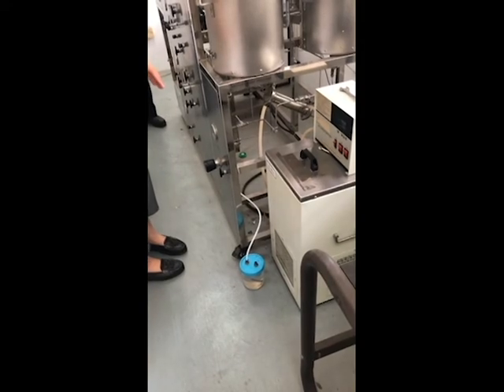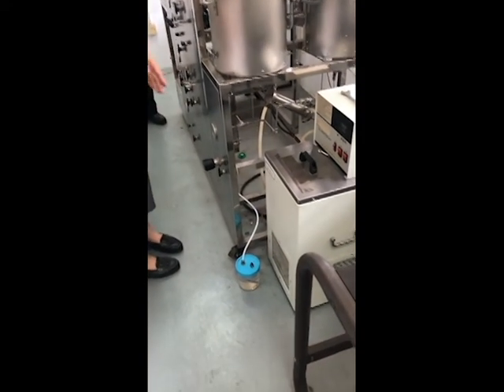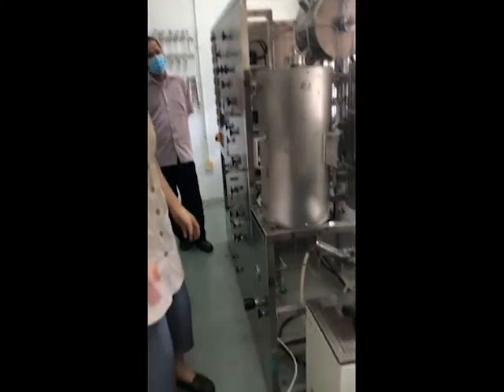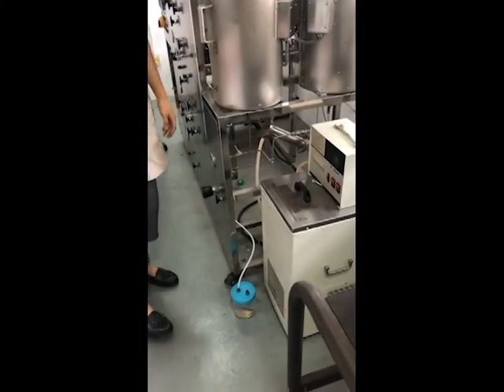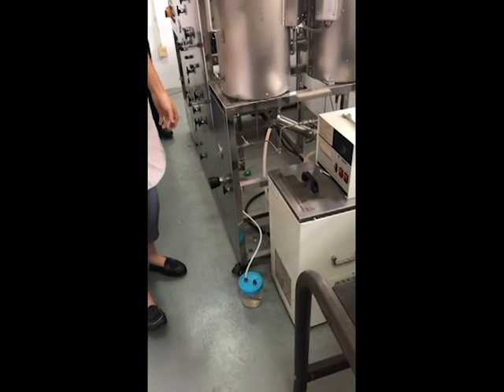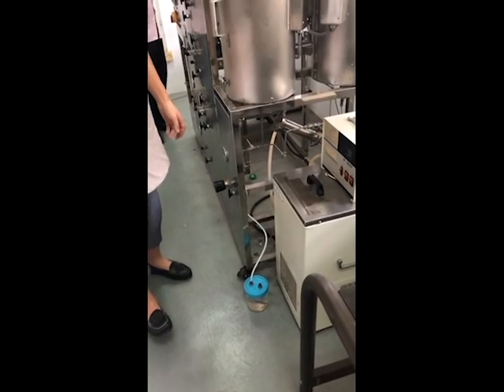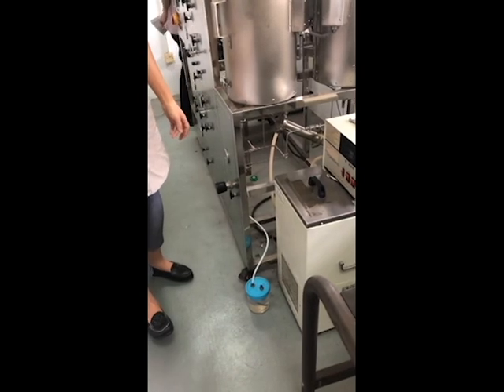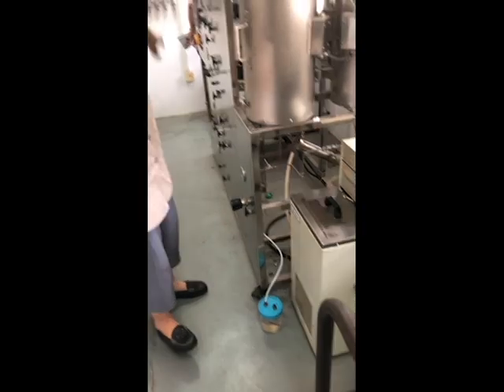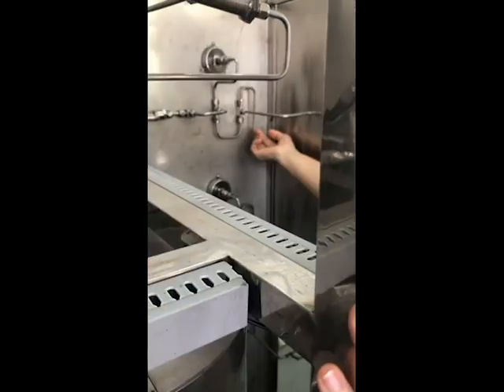To determine whether your gas is flowing continuously, you can check the mass flow controller. If there is not enough gas flow to support the mass flow controller, it will give an error because it cannot reach the set point. So you must pay attention either here or at your mass flow controller. This is the trivial part.